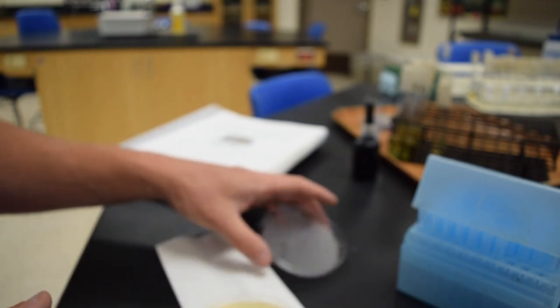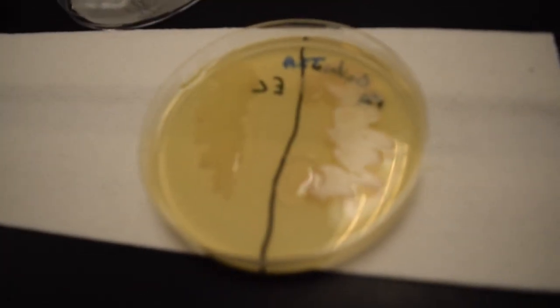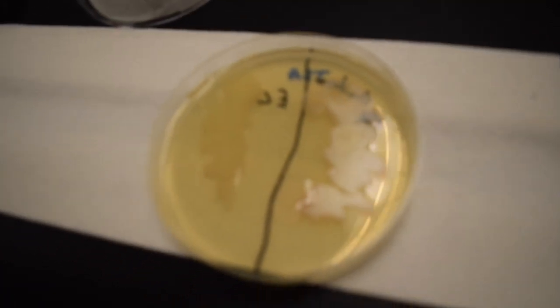Next test is the oxidase test. Here we're going to simply add a couple drops of the oxidase reagent. We're looking for a color change to a pink maroon color within about 2 minutes. Usually it happens pretty quick. And I will take a still shot of this as well. It's very hard to see with this lack of focus on this camera. But I am seeing a pinkish color turn around the Pseudomonas, whereas the E. coli is remaining colorless.